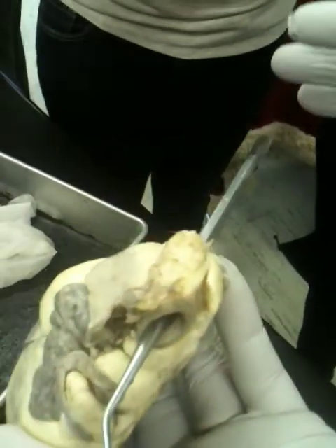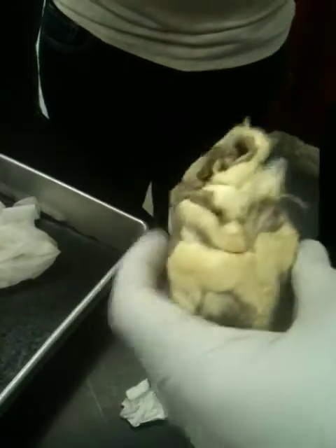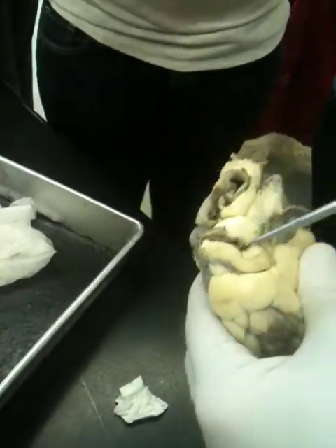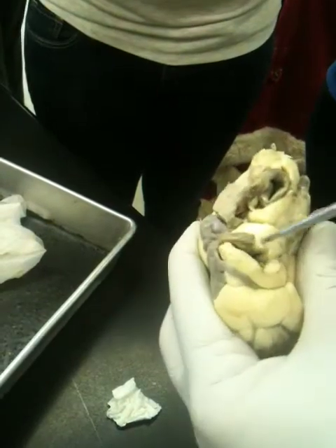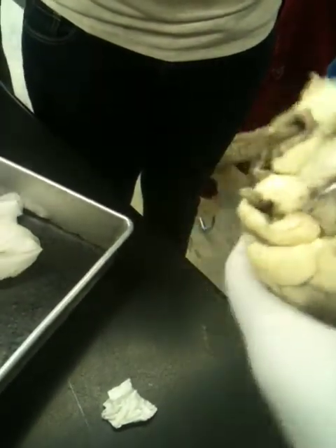And then there's two areas of veins. Now you don't see the veins. All you get are holes. So on the left-hand side of the heart, big jagged hole over there on the left, there it is. What's that? Pulmonary veins.